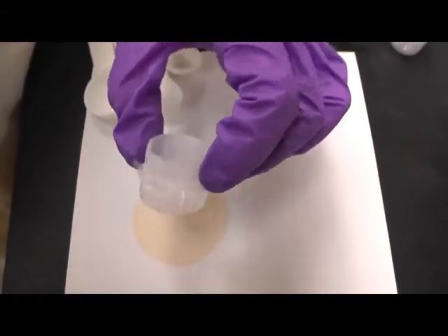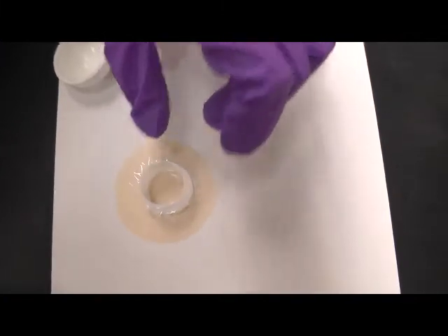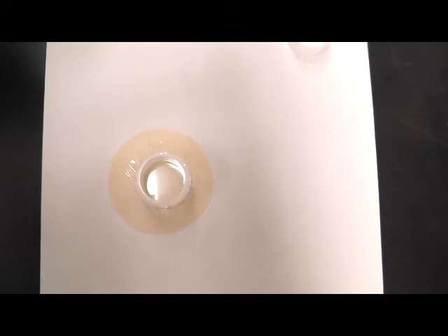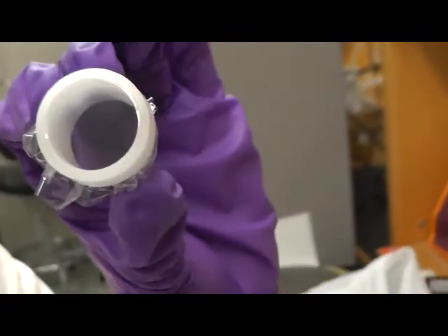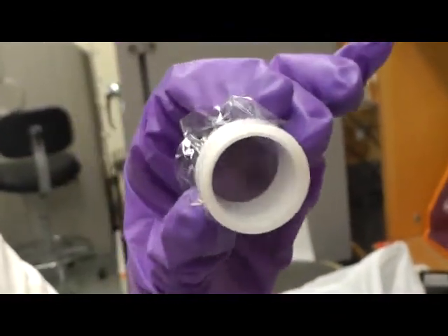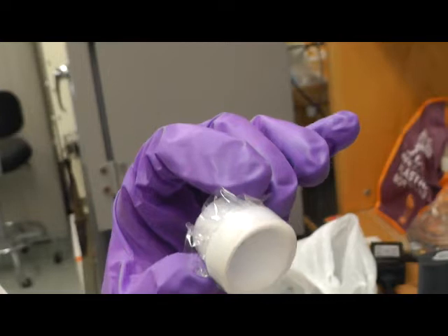And then here is how it looks like. Make sure that the thin film is flat between the ring and the middle one. And if somehow the thin film is distorted, just throw this part away and make a new one.